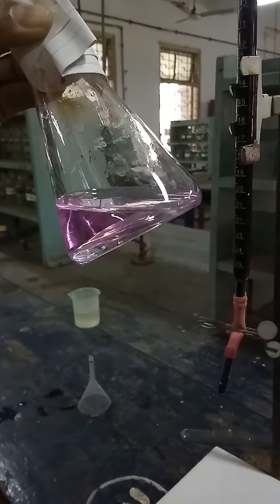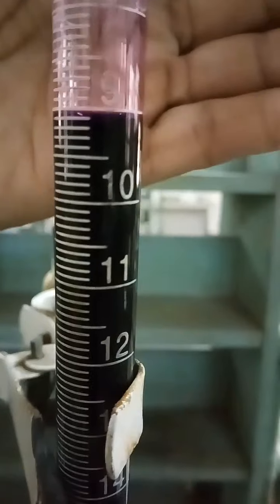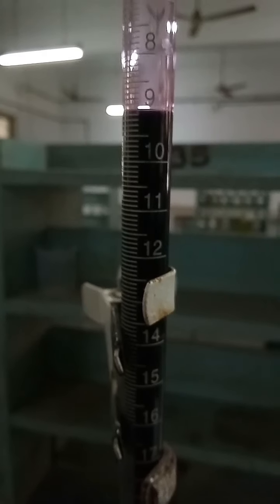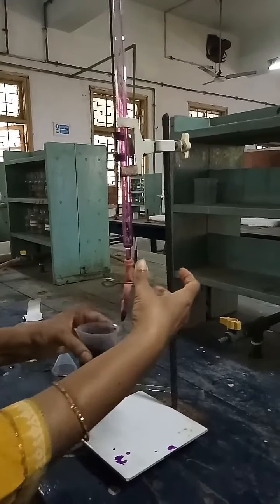As you can see, we get a permanent pink color which is our endpoint. Now we will see our burette reading. We have a colored solution so we have to see the upper meniscus — our upper meniscus is at 9 ml. So our burette reading is 9 ml. With the same process, you have to repeat the titration to get a constant reading. After finishing your experiment, clean all the apparatus with water again.